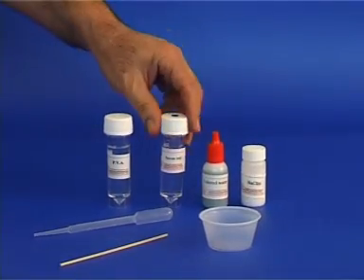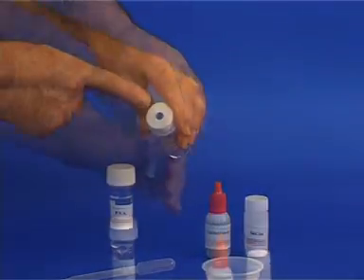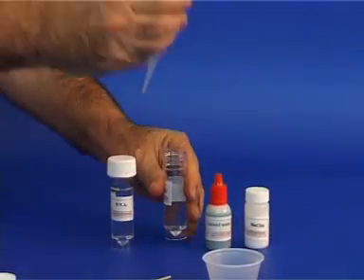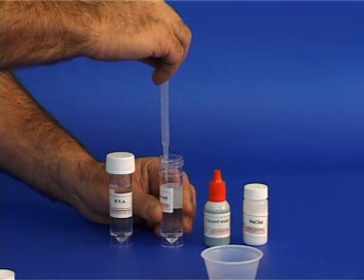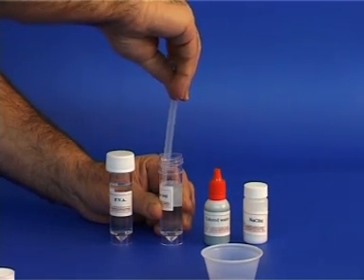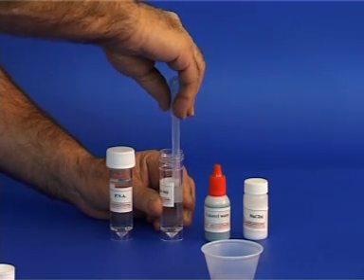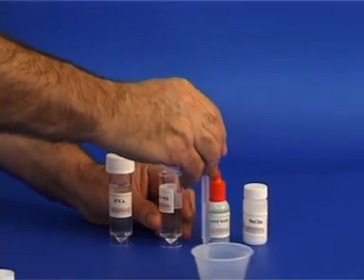Take the borax solution. Note that it is marked with a blue dot. Unscrew the cap. Fill the dropper with 3 ml of the solution. Squeeze the air from the dropper, place it in the solution, and release the pressure. Make sure that you have 3 ml inside the dropper and pour its contents into the reaction vessel.